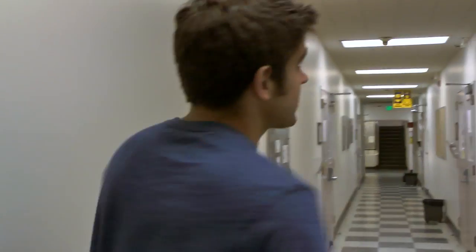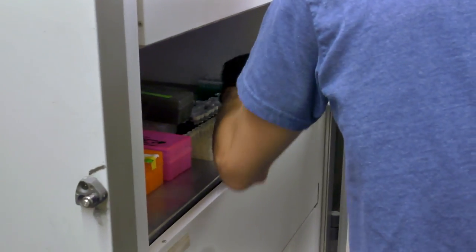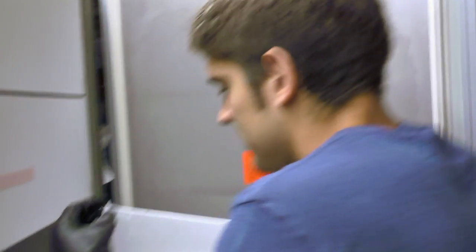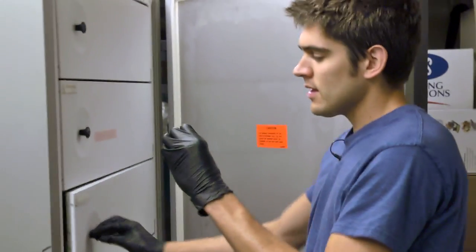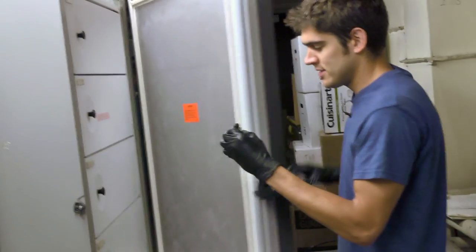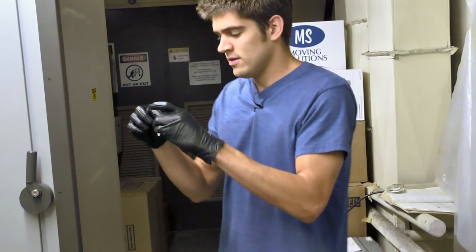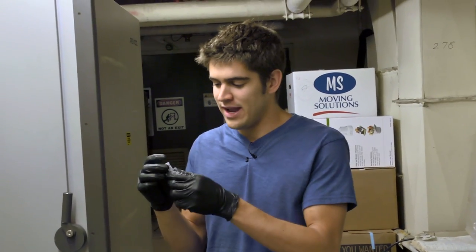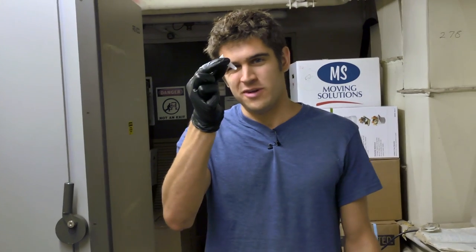So unfortunately our freezer's broken in that room, so I'm just going to run down here to another freezer where we're currently keeping our antibiotic stock. Got my neomycin. Oh, perfect. I forgot that neomycin is one of the few antibiotics that's actually stored in only water. So it actually freezes in the negative 20. A lot of the other antibiotics are stored in ethanol and they don't freeze, so they're ready right away. So I'll have to wait for this to thaw a little bit, but luckily I found one with just a small little amount in there, so it should thaw pretty quickly.